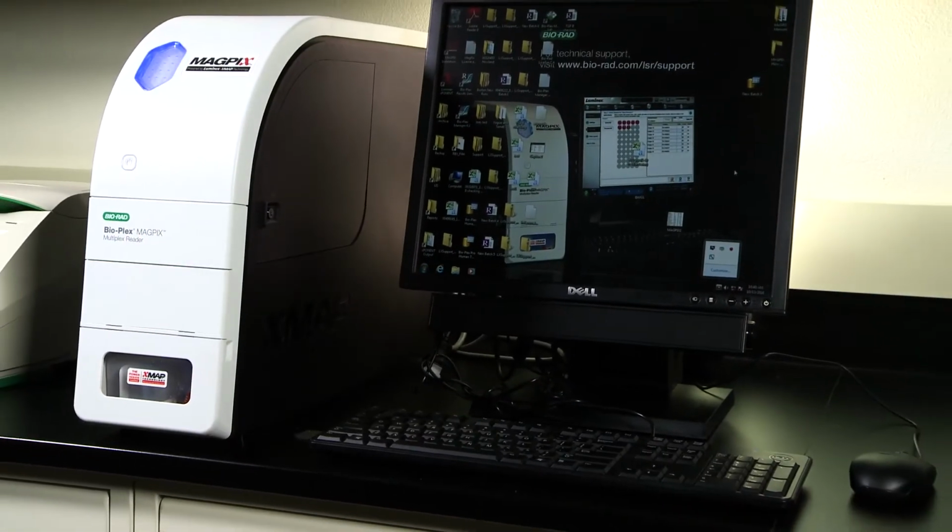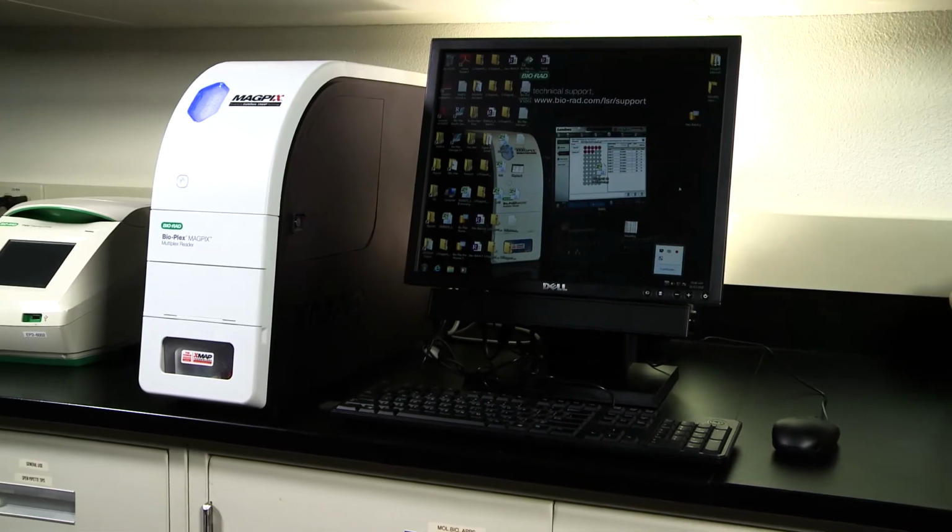If the Bio-Plex MAGPIX instrument is not used for a period of time, or the samples tested were viscous in nature, the MAGPIX sample probe and internal flow chamber could be contaminated with beads. This could lead to a failure in instrument calibration or verification.